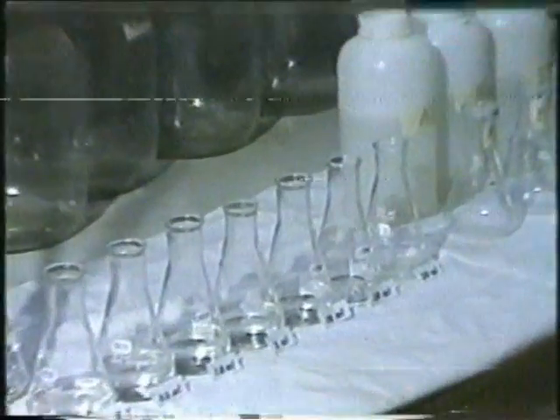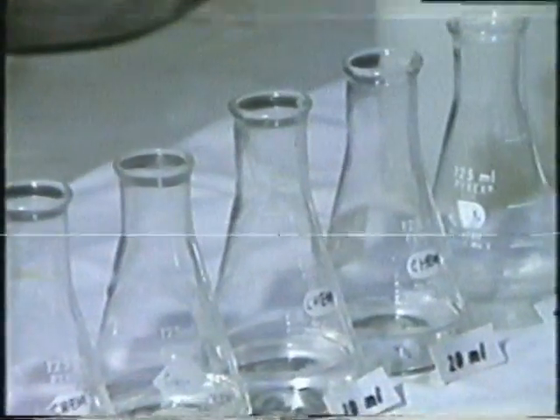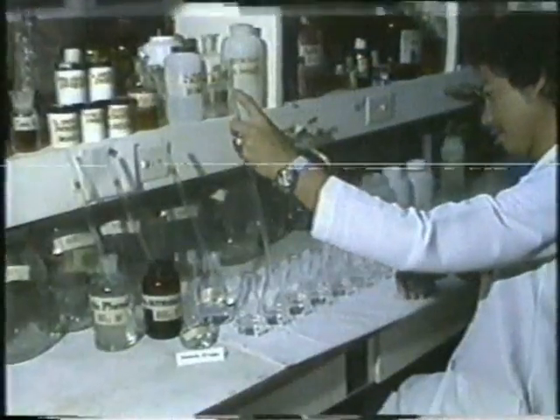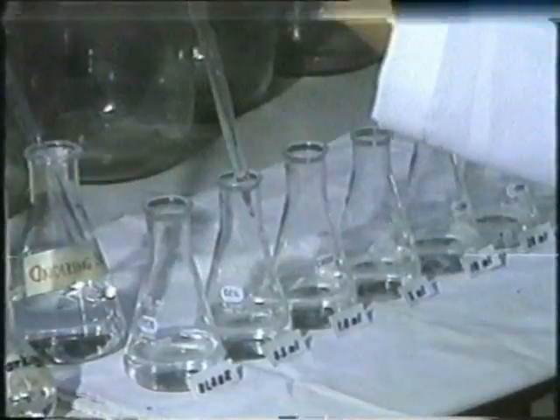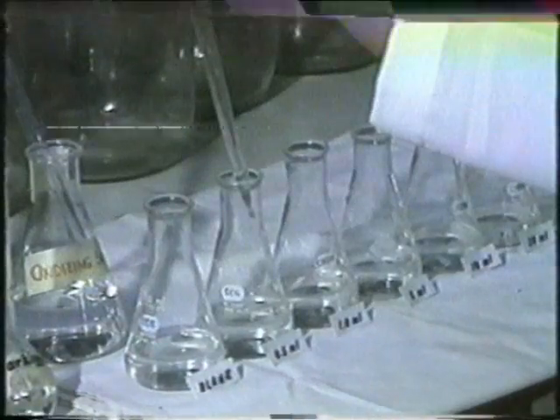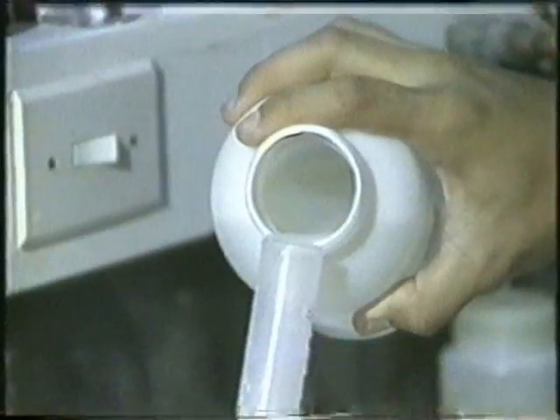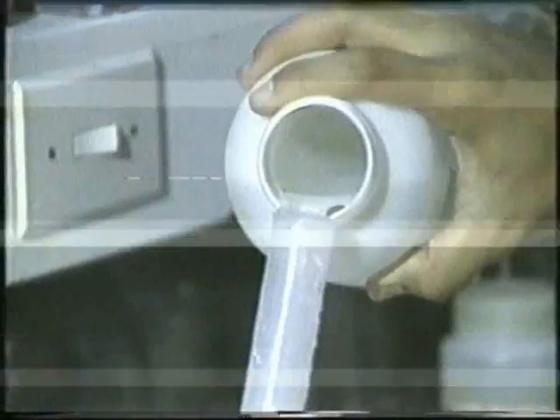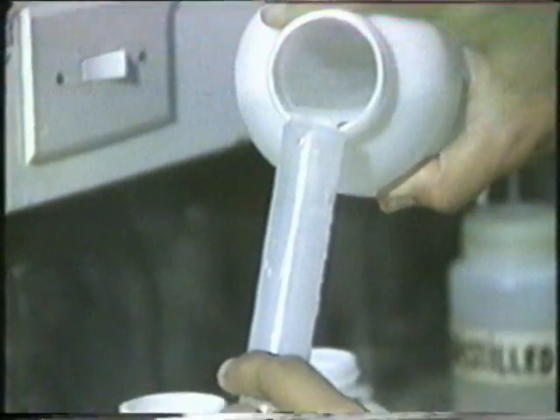A series of dilutions with increasing known amounts of ammonia nitrogen is first prepared by pipetting increasing volumes of standard ammonia solution. 50 milliliters of the sample water, of which the ammonia nitrogen level is being sought, is measured either with a 50 milliliter volumetric pipet or a graduated cylinder.